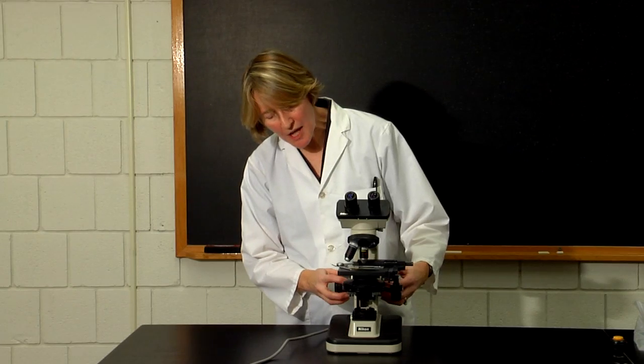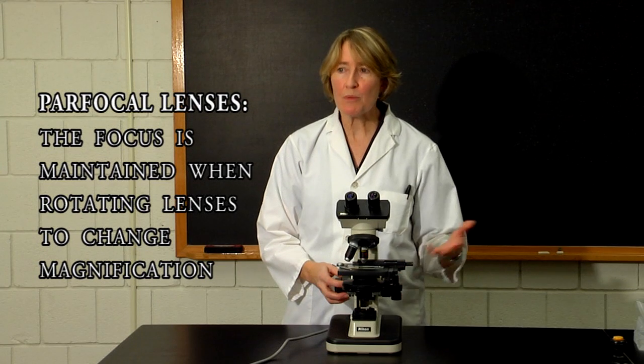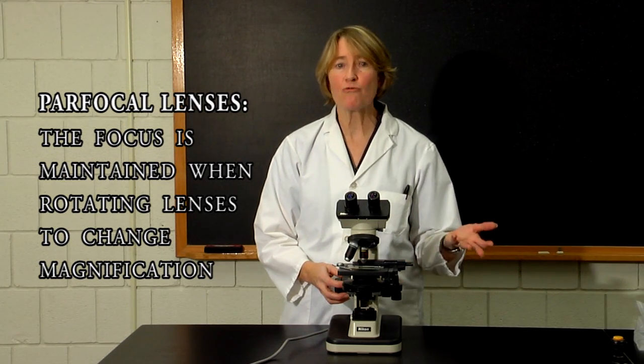Once you have your sample in focus with the low power lens, you can then switch to the high power lens. These microscopes are essentially what we call par-focal, meaning that once you focus on the sample, you should be able to change to another magnifying lens and maintain relative focus.